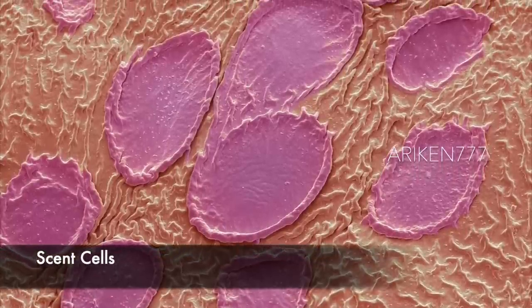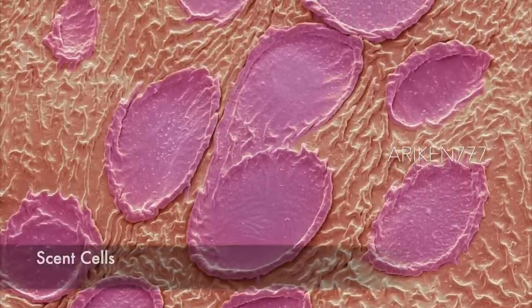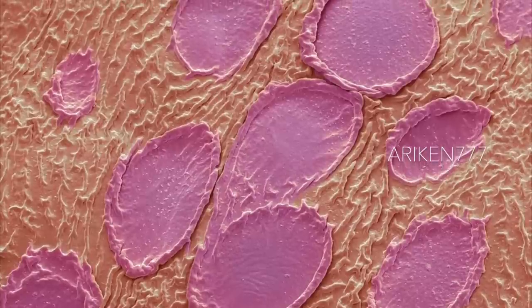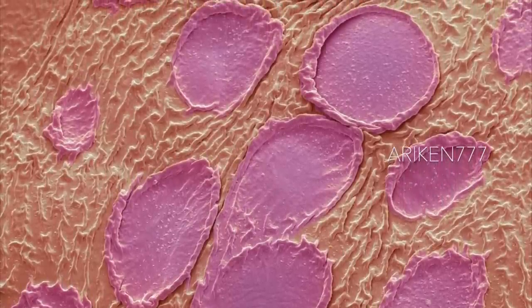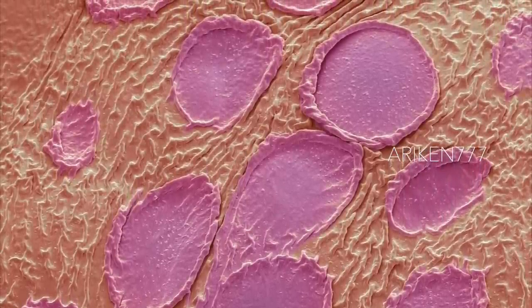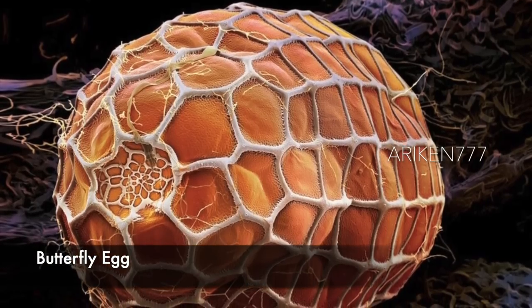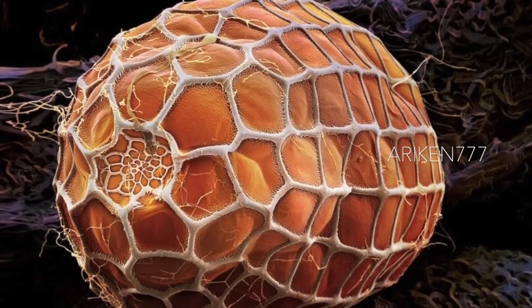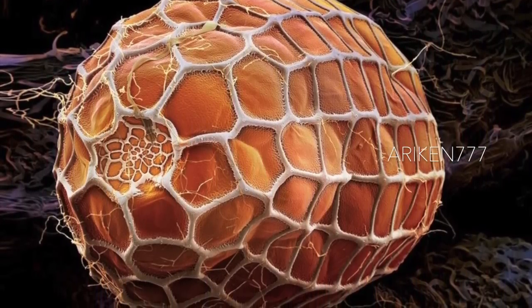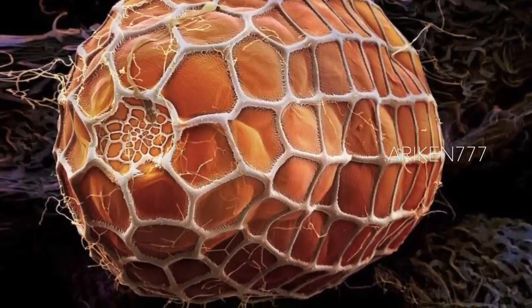Shown here are scent cells on a rose petal. The scent of a flower is produced by aromatic oils produced by cells on the petals. A zebra long-winged butterfly egg. The orange color of the egg serves as a warning to predators, as the egg contains cyanide and other toxins.